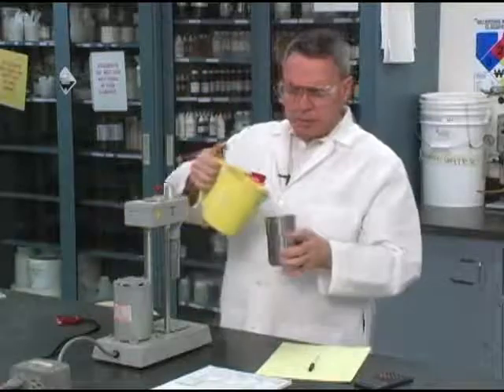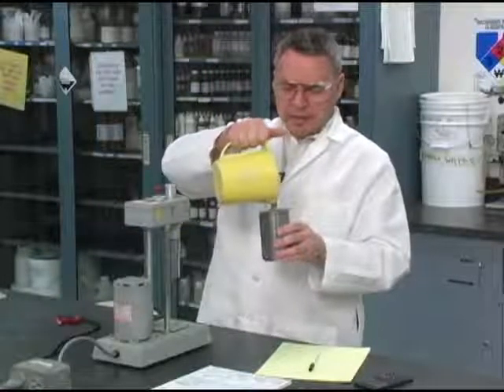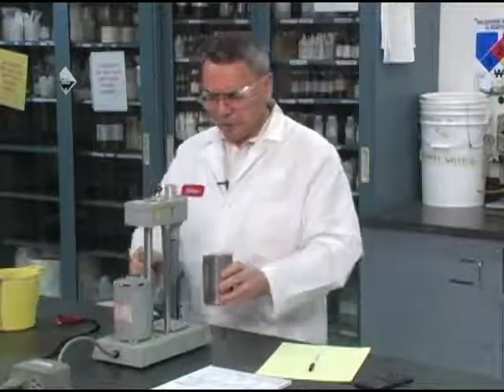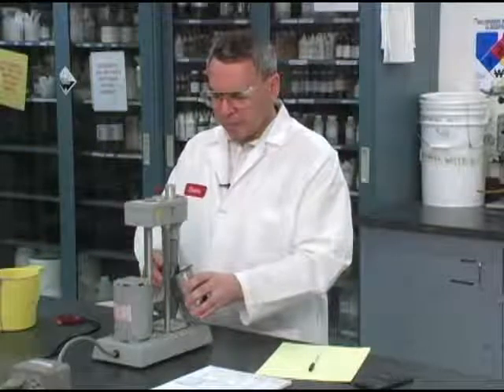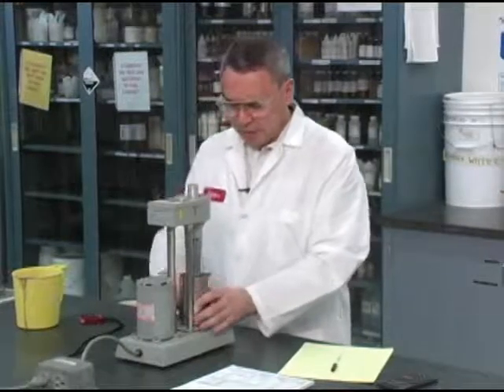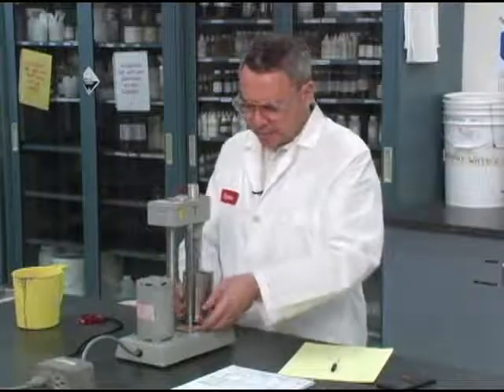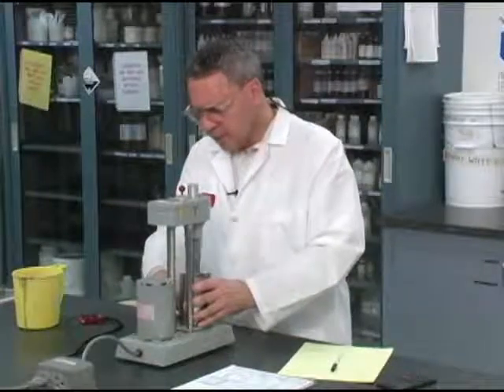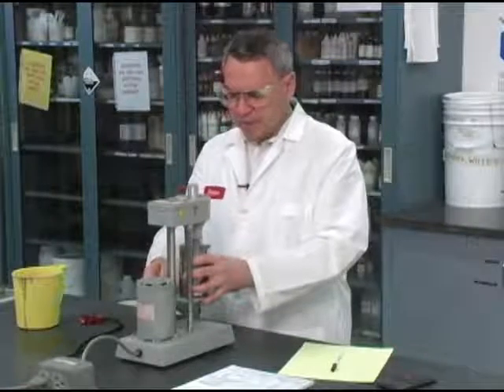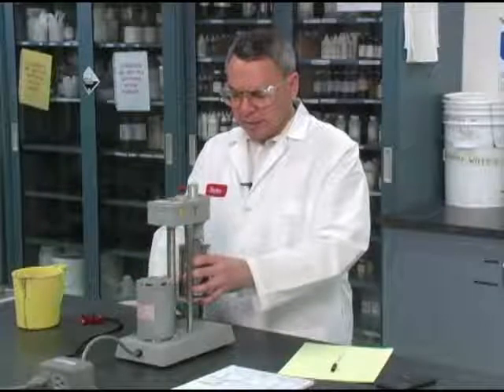So what I'm going to do is fill the cup to a certain line, which indicates that that's the proper level. And I'm going to put this in a proper position, lifting to a certain level. This has to click into a certain position like it was a bayonet device. And now all I have to do is lift this and put it in place according to a rim I have here in this bob device.